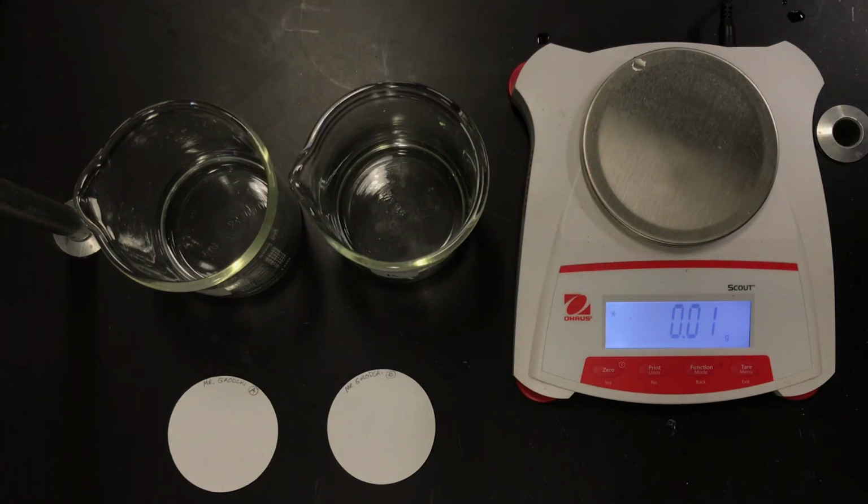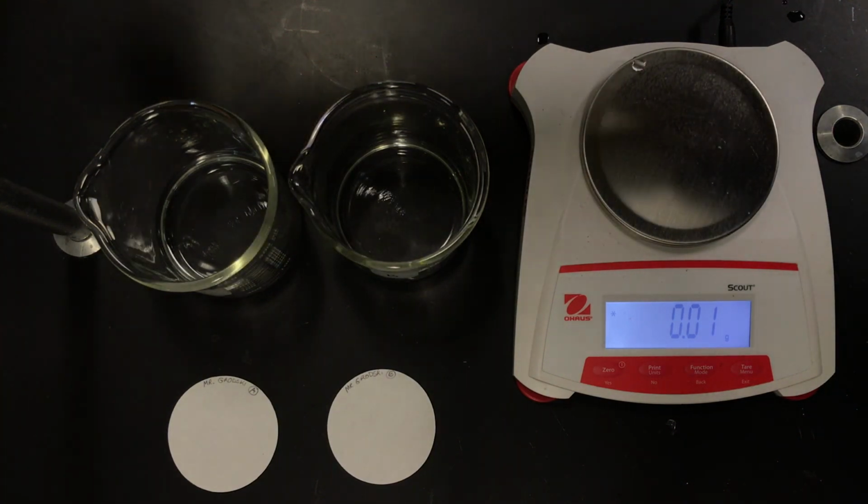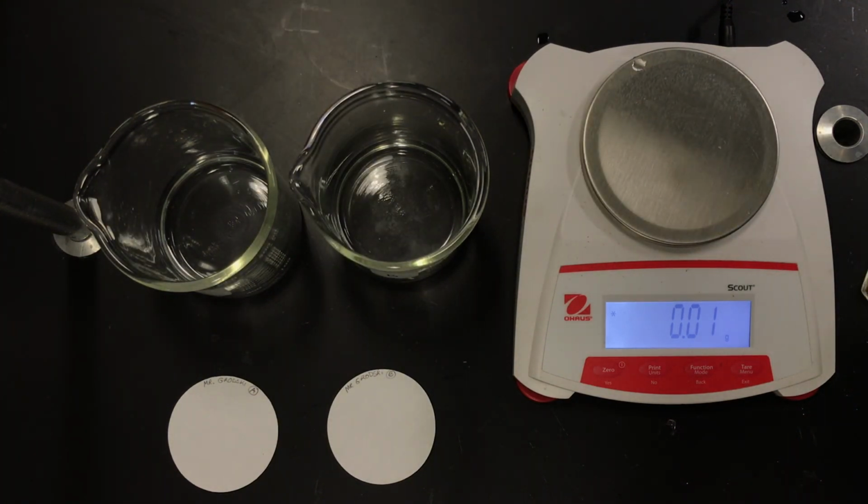And I'm using 125 milliliters, at least 125 milliliters, because I want to add excess. All right, and when I add the calcium chloride, we should know that we're really delivering calcium +2 ions and chloride ions. And we know chloride ions or halide ions, like chloride ions, are soluble. There are some exceptions you should be aware of, but those exceptions do not exist in this beaker.